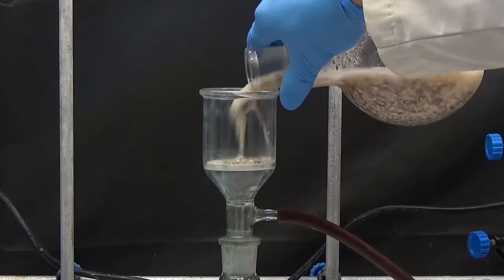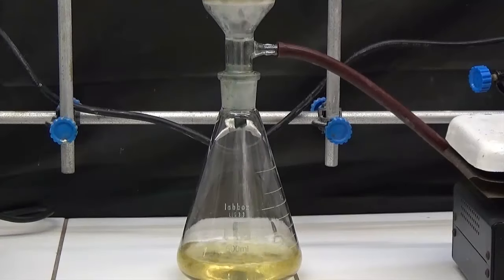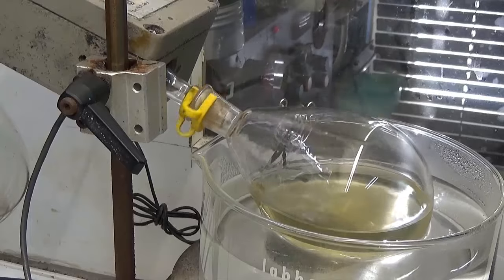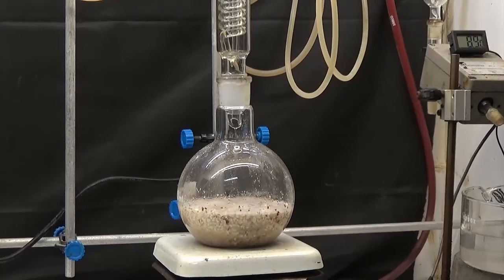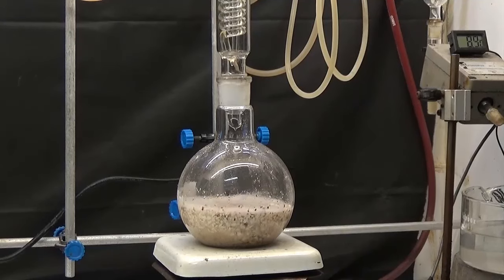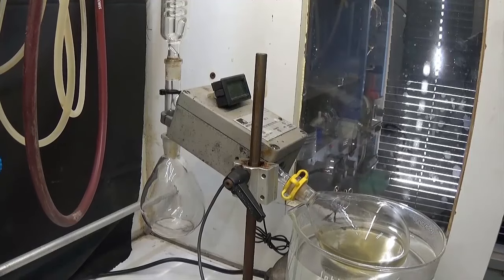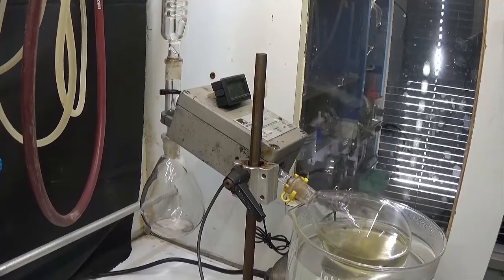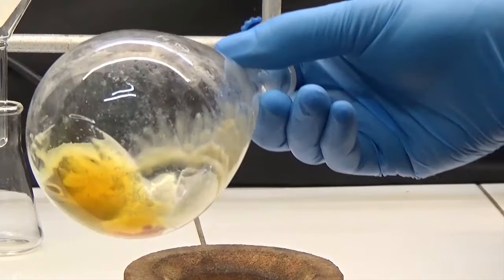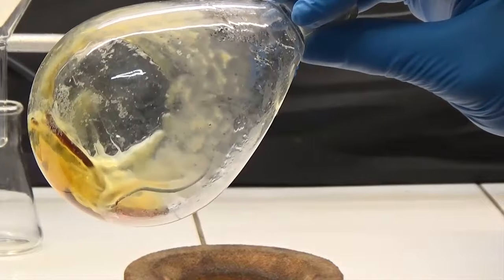Separate the solid by suction of the liquid phase. The liquid phase is evaporated under vacuum in a water bath. Reflux the solid with ethanol distilled in two hours, filter and evaporate ethanol in the same rotary evaporator flask. A thick residue of caramel remains within the flask.